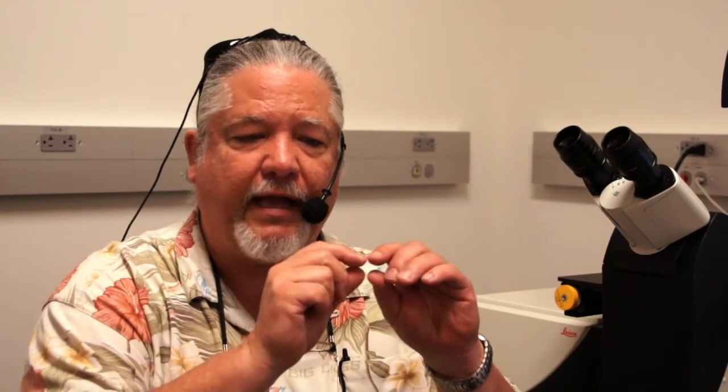Another very important benefit of the confocal microscope is that we're doing live cell analysis. Yes, you can do live cell analysis on a fluorescent microscope, but with the optical sectioning on a confocal microscope, you are now looking at individual molecules being excited by the laser and the fluorophore that's attached to them in real time in a living cell. So it's a very powerful instrument for doing live cell imaging in real time.